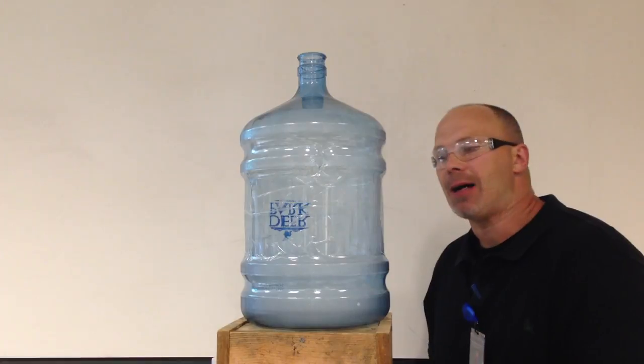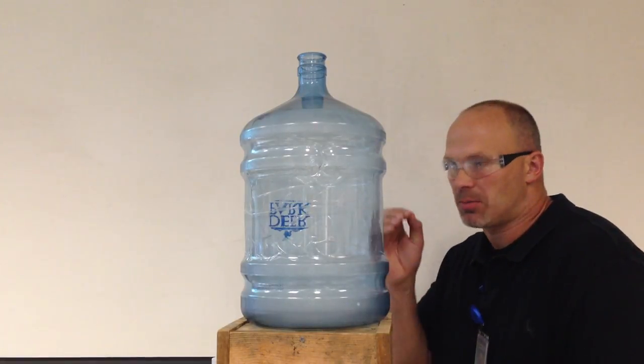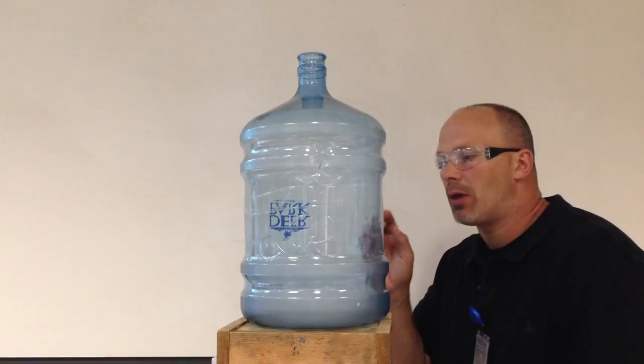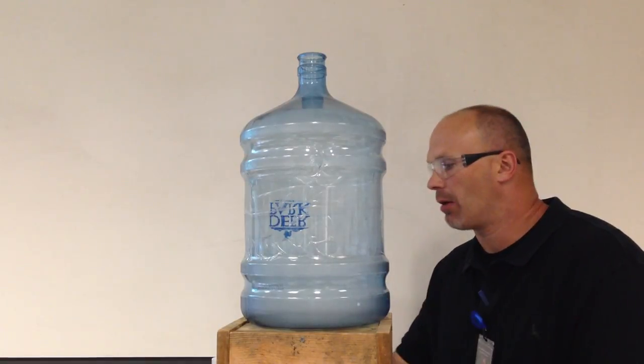And that's going to be the activation energy that's going to react oxygen that's in this container, as well as nitrogen, but it's going to be oxygen that reacts with the alcohol vapors, the wood alcohol.